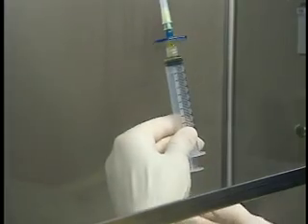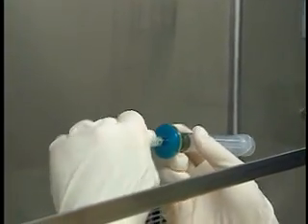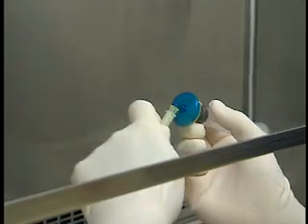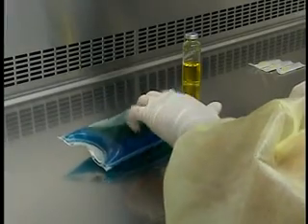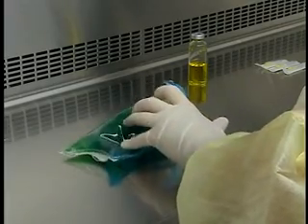Check the integrity of the filter by trying to draw air into the syringe and rapidly releasing the plunger. The filter is intact if a spring effect is felt. Make sure that the finished product meets required quality standards.